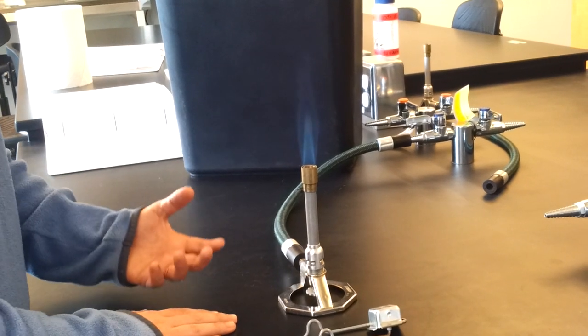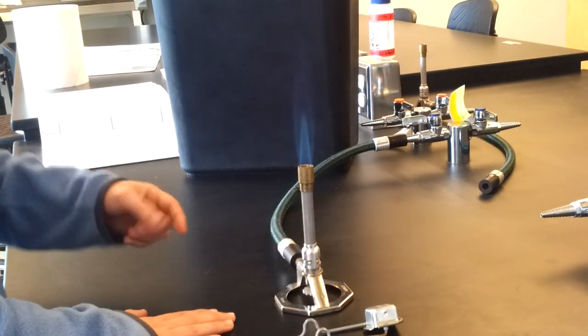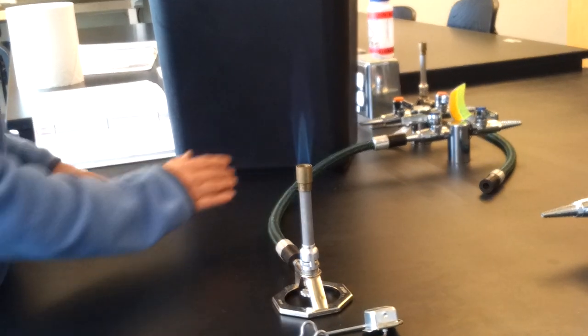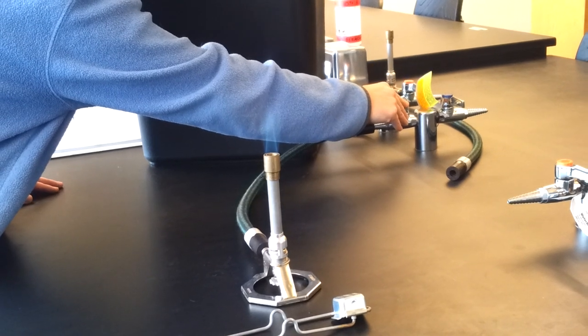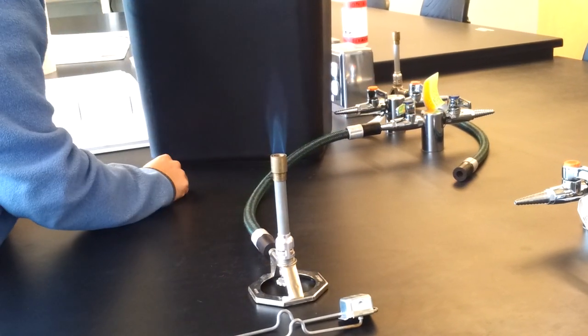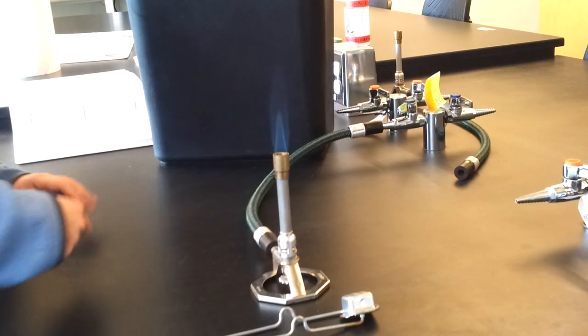Maybe the flame is a little too vigorous for what you and your partner want. If that's the case, then you can turn it down a little bit with the knob this way. But if you go too far, the whole thing will go out. See how I turned it down just a little bit that way? That's still a nice flame.